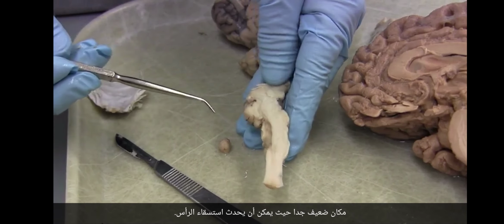Where's it going to? It's going to here. It's going to the temporal lobe. Do you guys see this? This is the C. The brain is very University of Chicago, and it has a C, just like the University of Chicago logo. So it comes back here, it has a backward spur before going down to the bottom of the C. So it's a C off the midline, a little. It's a C that goes around like a ram's horn.